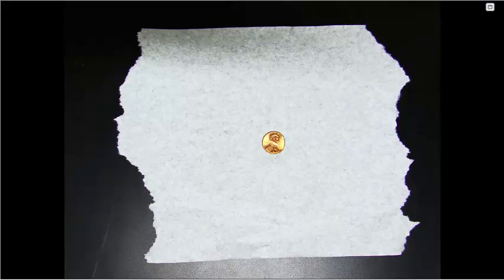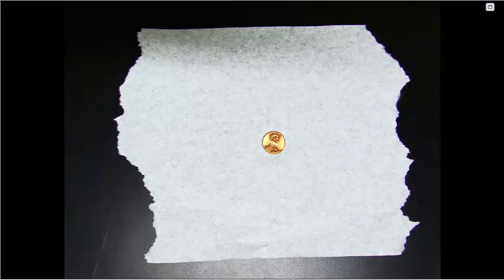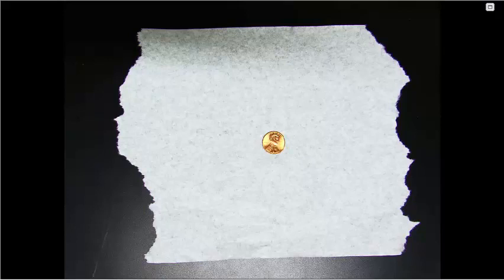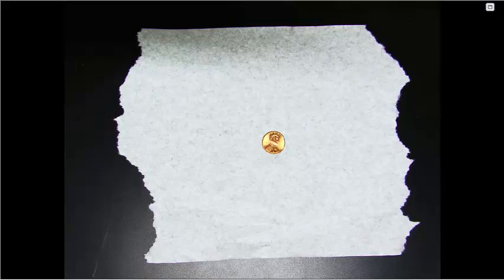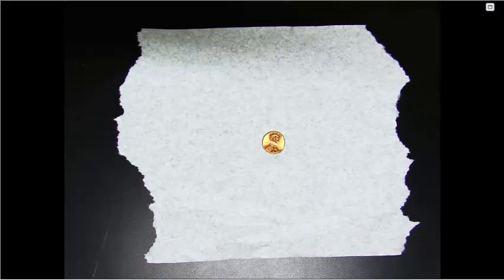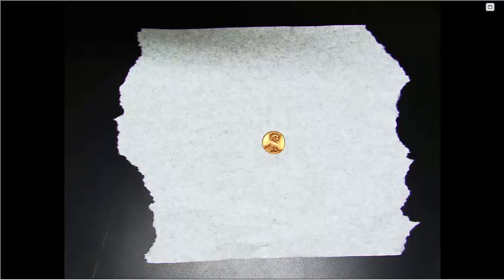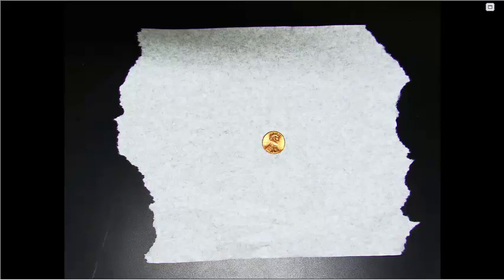Welcome to biology. In this video we are going to go through the procedure for the drops of water on a penny lab and record data so that our virtual students will be able to complete this lab conclusion.